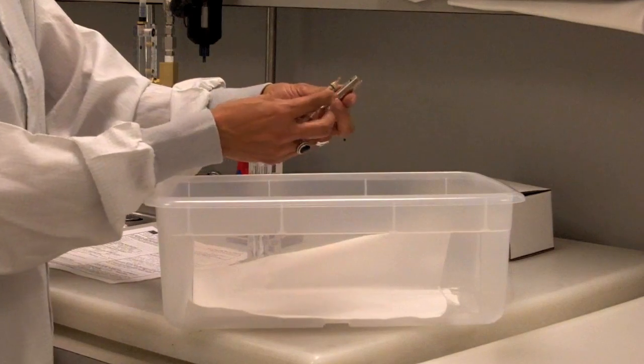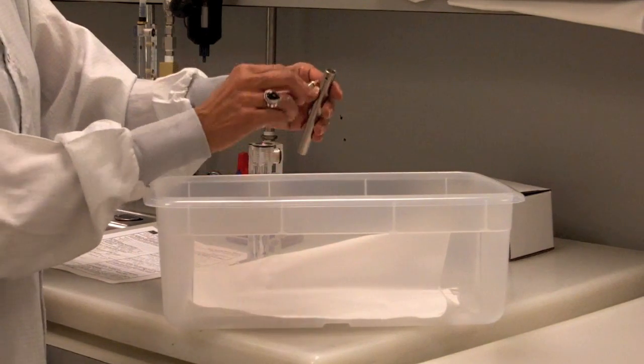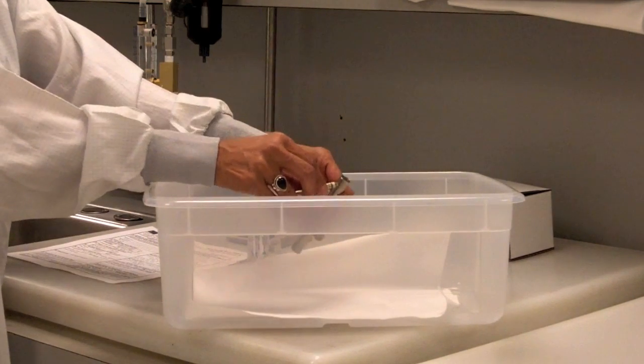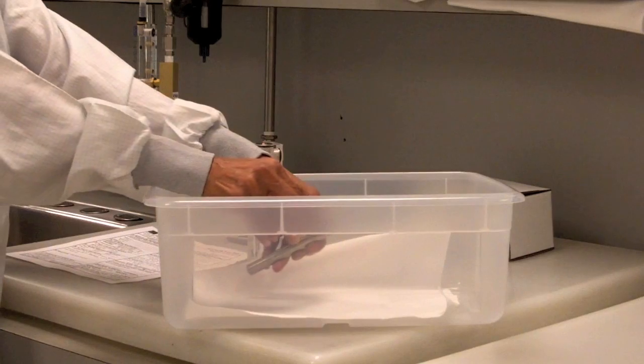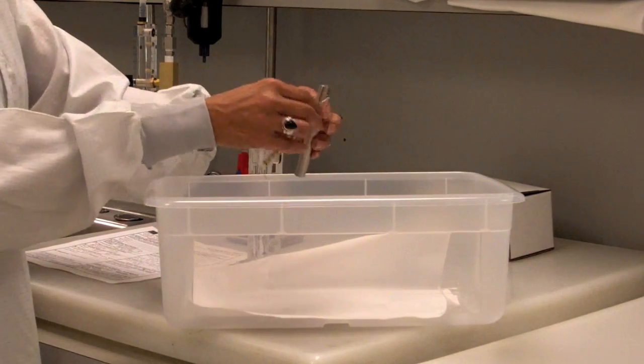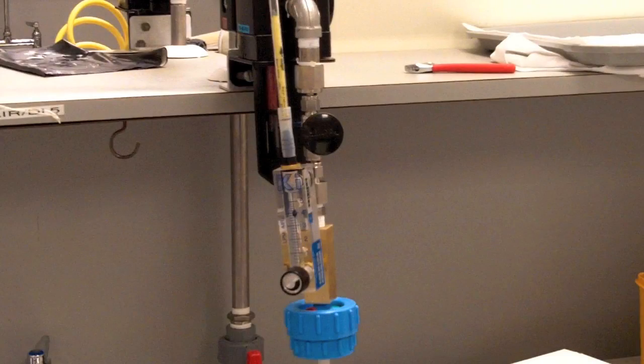Insert the tip of the tube into the smaller of the 2 holes of the tip breaker and apply sideways pressure until the tip breaks. Break both tips of the detector tube. Please use caution when breaking tips, inserting the tube into the tube flow meter and handling the tube.